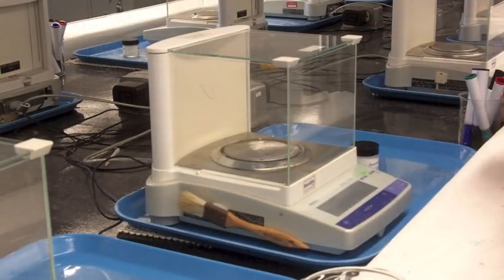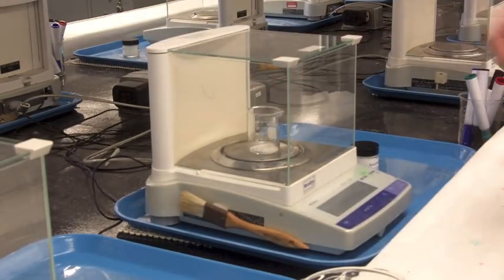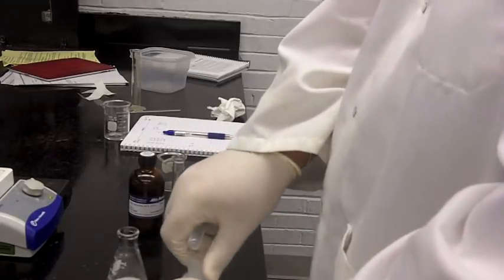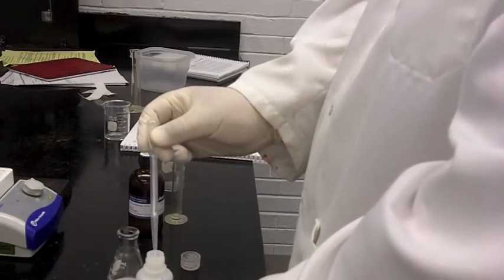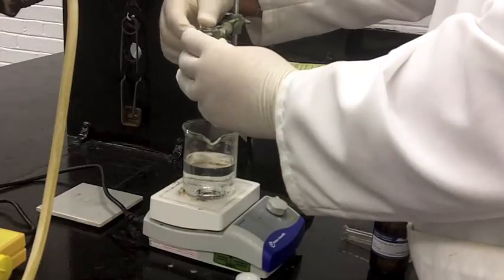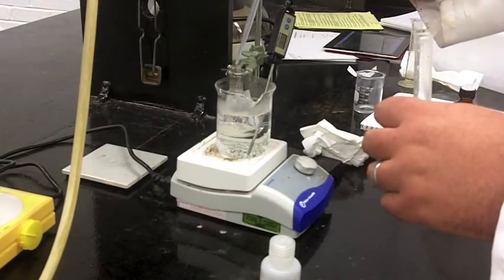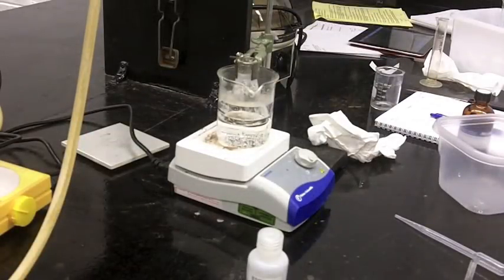The protocol works exactly as it's in the manual. You're going to weigh out some salicylic acid and get a mass for that. You then put on gloves, measure out your acetic anhydride and add that to the mix, then add some phosphoric acid — the amount is not critical, it's about five drops into the mixture because it's a catalyst. Then the hardest part will be manipulating your clamps to get it into some hot water, ideally heated beforehand. You'll let it cook for however long the manual says, then add some water. The water will get rid of the excess acetic anhydride — this will be the step that probably generates the stinky part.